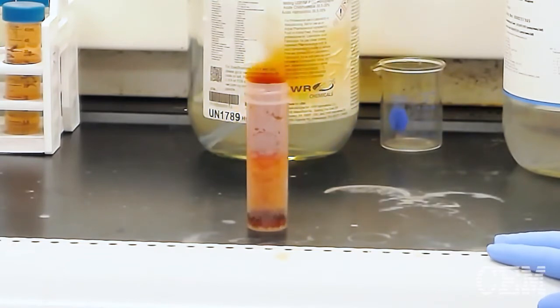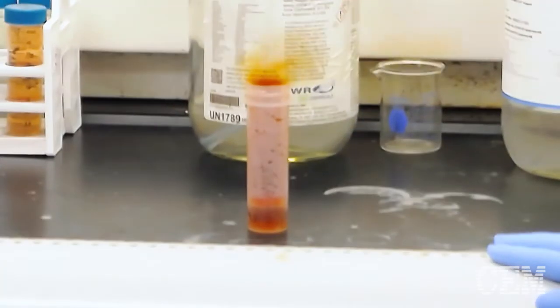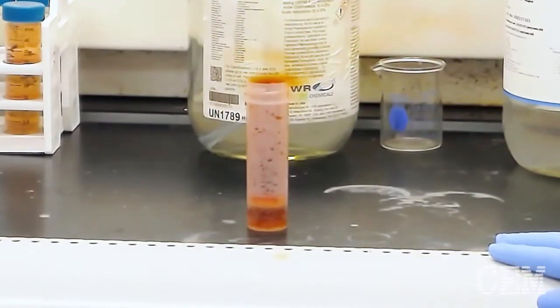Whether your sample is high in fats, alcohols, sugars, carbohydrates, starches, you want to make sure that you do a predigestion step. Or if they're unknown, you always want to start with a predigestion step. As you can see here, an exothermic reaction is taking place at room temperature.